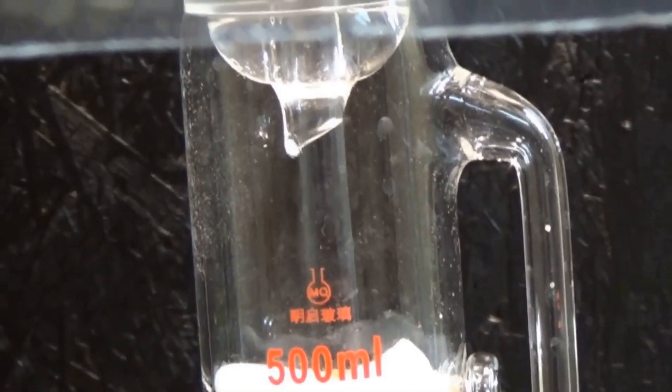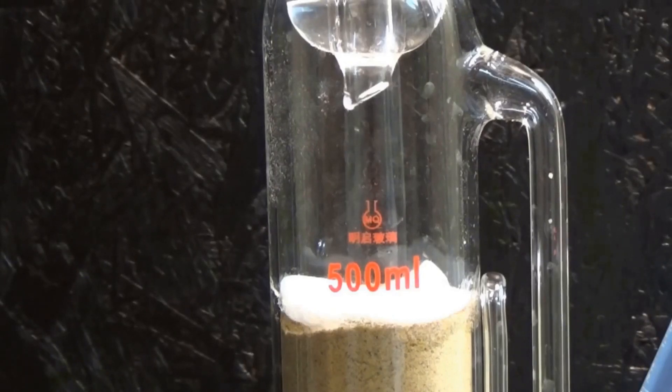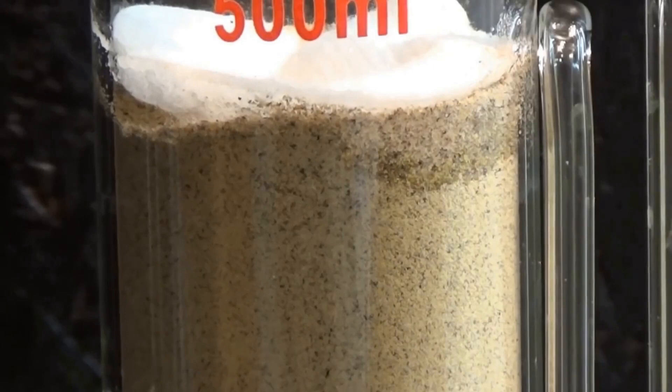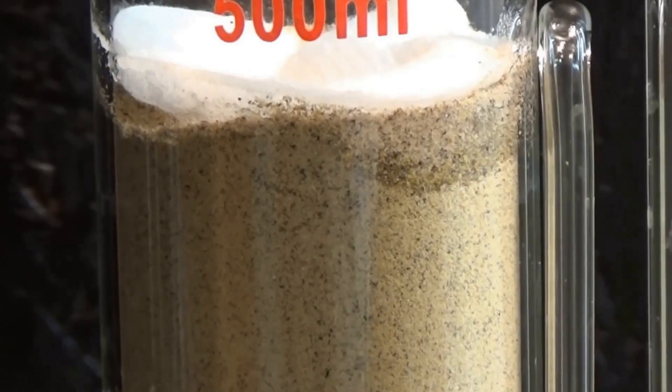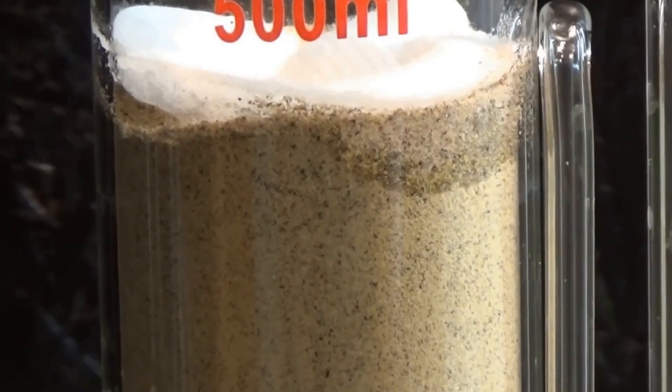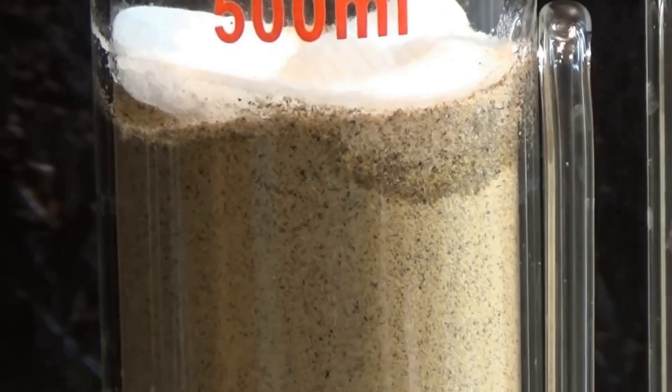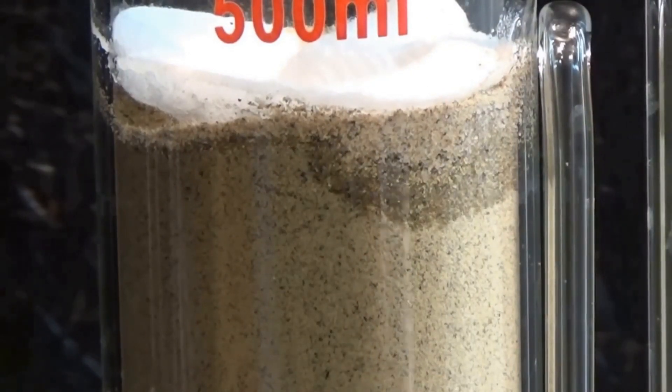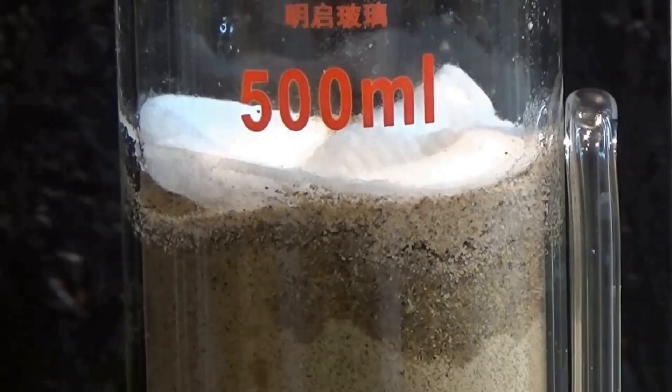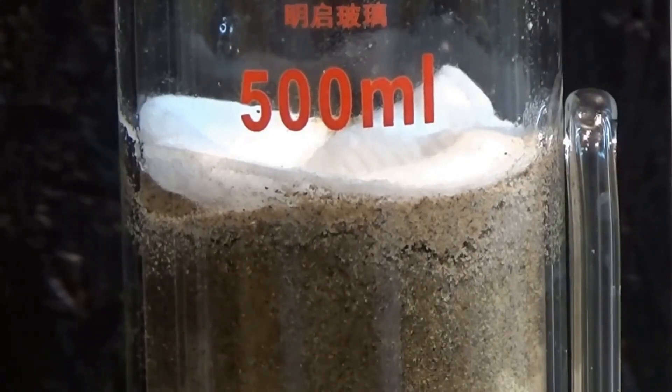Because this was my graduation project in chemistry, I wanted to get the maximum yield, so I extracted for a further five hours. If you're short on time and you don't need as much piperine as you can get, I highly recommend using a coarser grain or one of the extraction shells because it will save you a couple of hours in waiting.